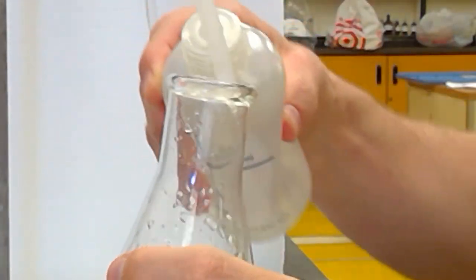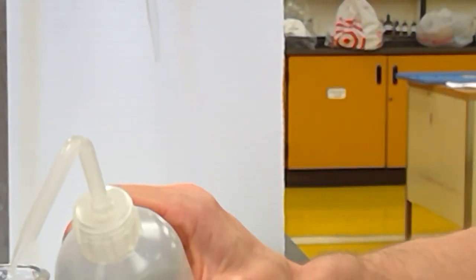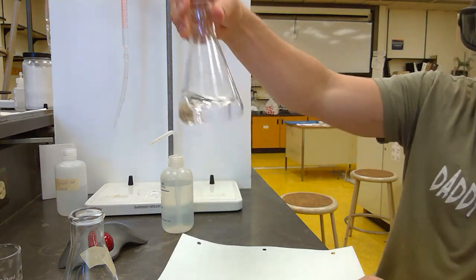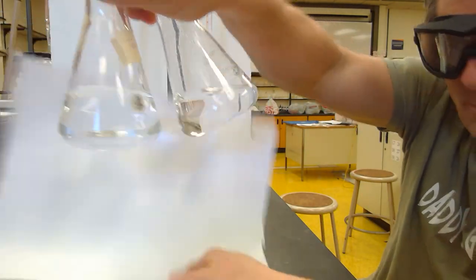I'm going to spray that partial drop down. And it's going to have this little off shade of pink. I don't know if that is enough. Nope, I don't see it. Let's do another partial drop. Just a little bit of a drop there. Tap that off. I spend most of my time within a drop, probably, of the endpoint. Let me zoom out a little bit. Okay, that's fairly faint. Let's see if it persists. Nope, I still don't see it.